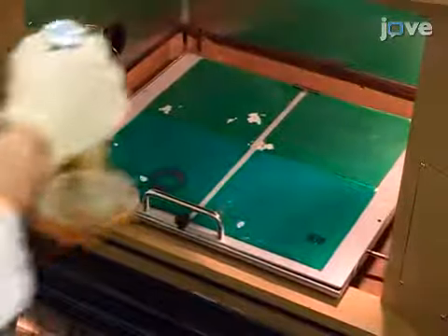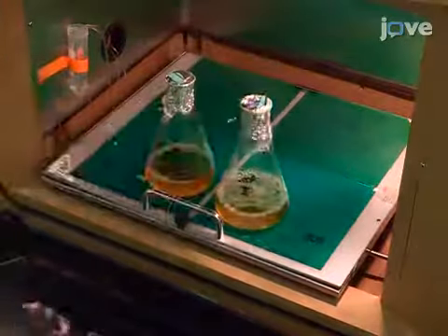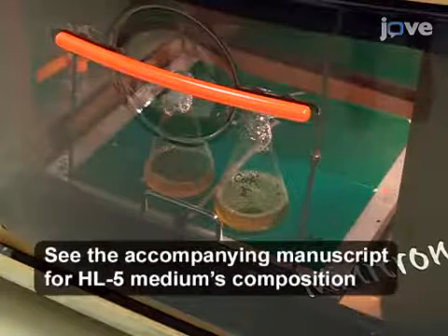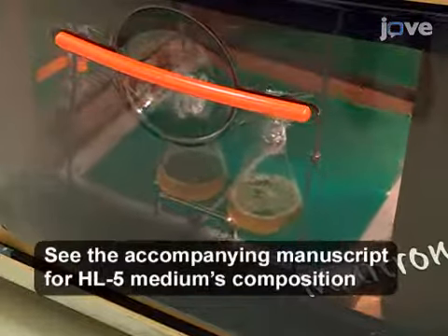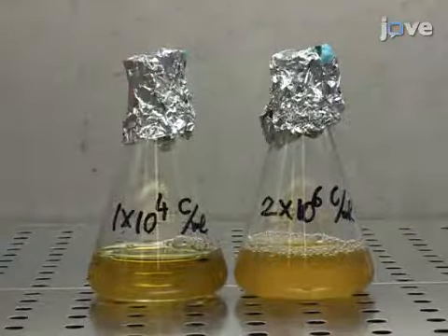To begin this procedure, grow DH1.10 cells or Coronin-deficient cells in an Erlenmeyer flask containing HL5 medium at 22 degrees Celsius in a shaking incubator at 160 rpm. Keep the cells at a density between 1 × 10⁴ and 2 × 10⁶ cells per milliliter.